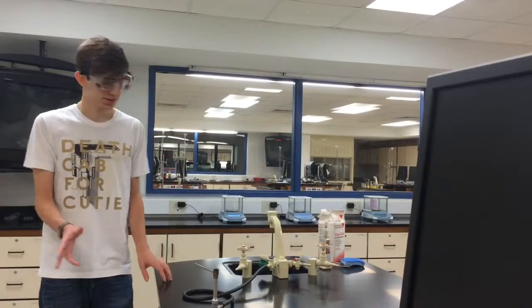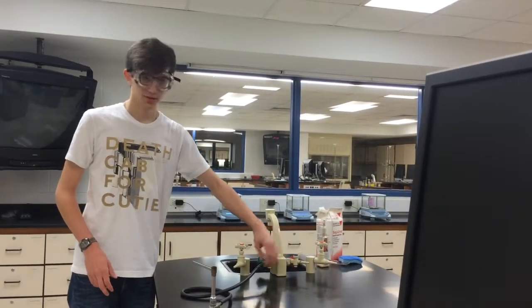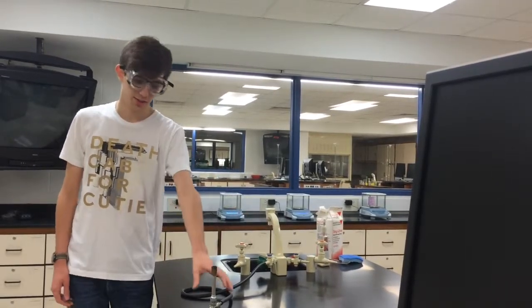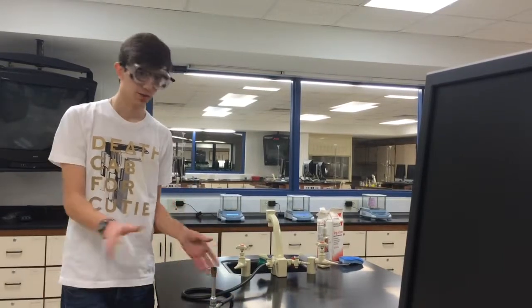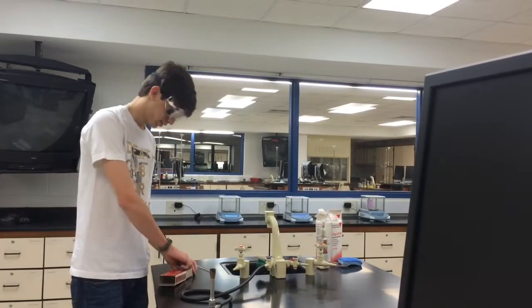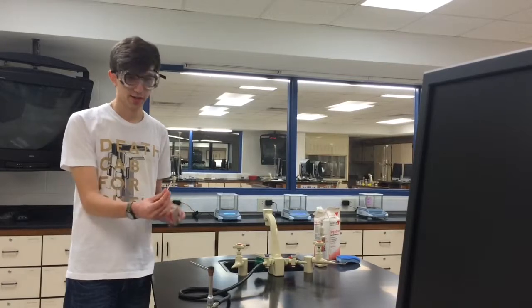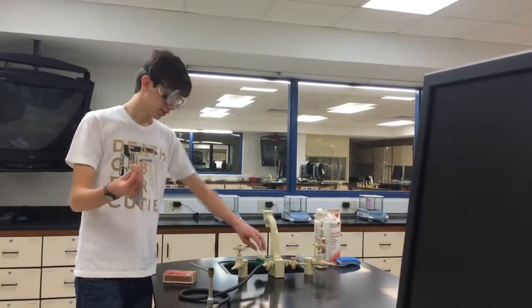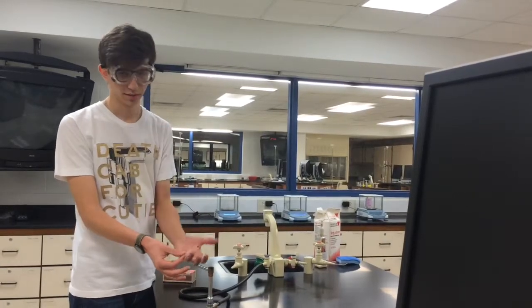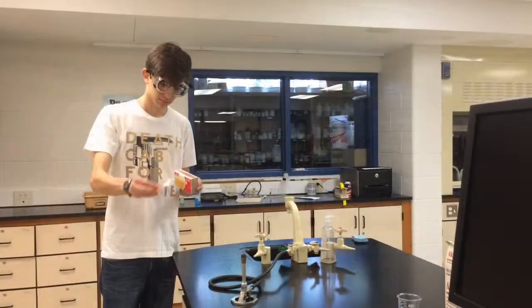Okay. Step 2 also entails that you make sure your gas nozzle is perpendicular to the gas flow and not parallel to it, because when it's parallel, it'll be shooting gas through, and then you'll be releasing gas through the Bunsen burner. You don't want to do that right now. Okay? So step 3, take your match in hand, and what you're going to do is strike the match and have it set on fire. Then you're going to start the gas. You're going to put the match over the Bunsen burner, and that'll start the flame. Put out your match, throw it away, and then you're going to adjust it.